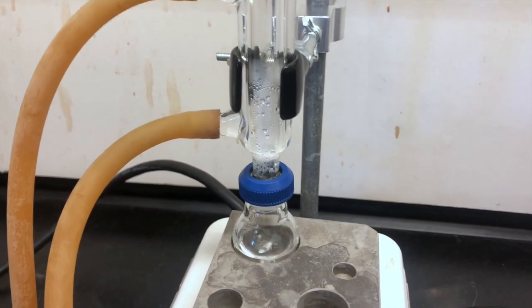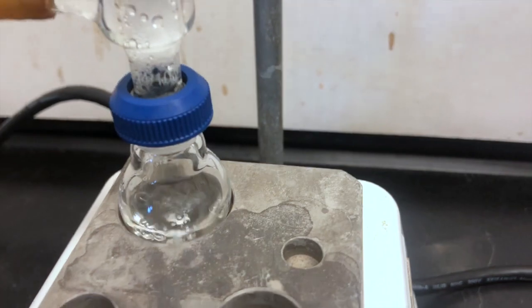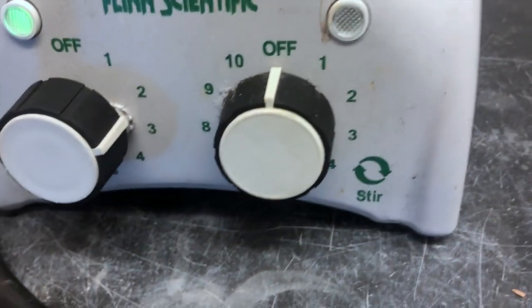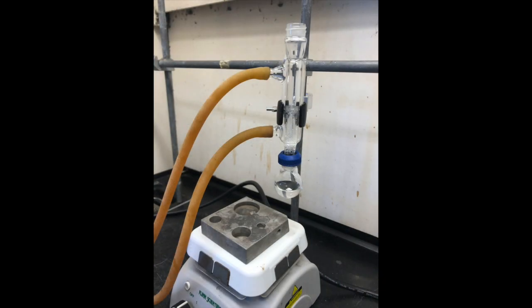The reflux condenser has quite a bit of liquid collecting fairly high and so we needed to turn the boiling rate down by removing the heat a little bit, putting it down to level 2.